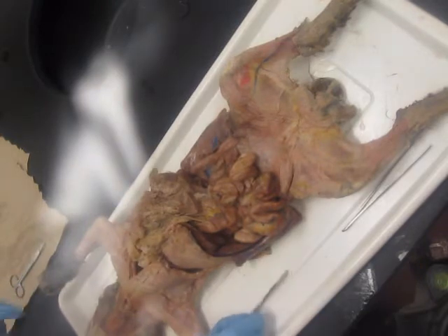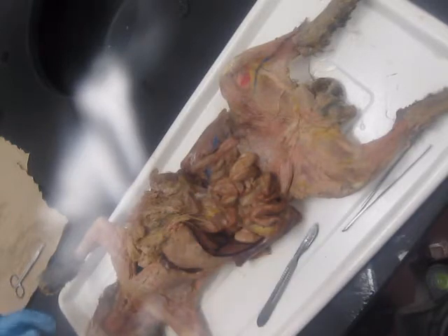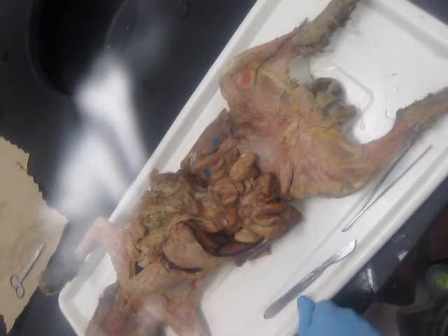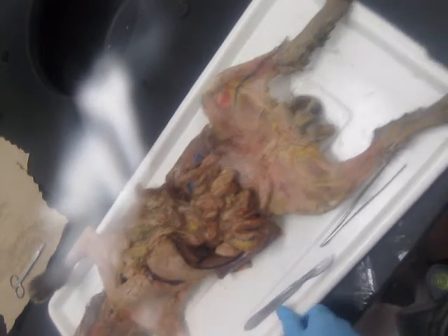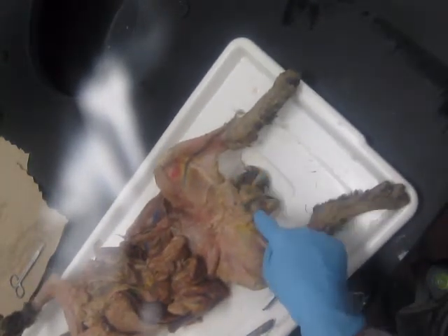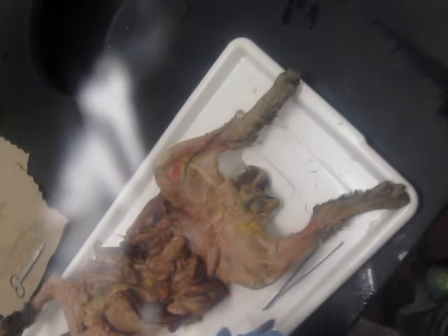Okay. Now we're going to skip adrenal glands for now because we're going to find those with the urinary dissection because they are retroperitoneal as well. And then ovary and testes. I can't show you ovaries, this is a male cat. So I'll come around the room for those that have females and point those out, and then you can share the information with your other teammates. But the testes are in the scrotum, and that's going to be a dissection for next time as well when we do urinary and repro.